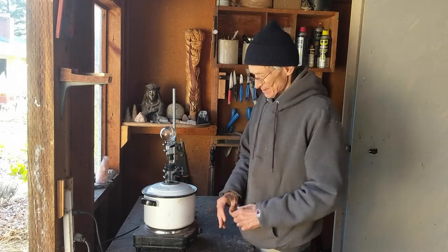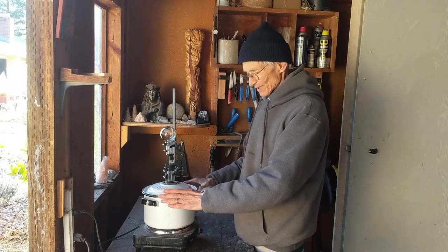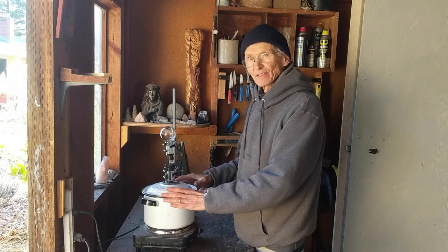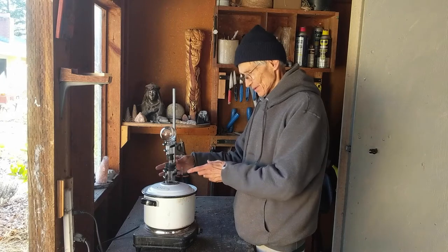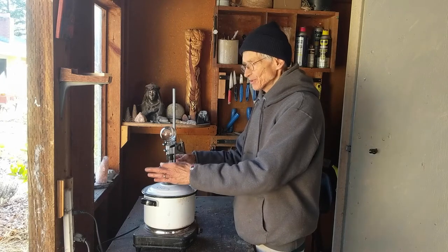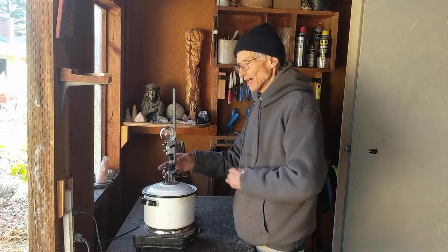Here you have a hot plate. Here you have a vessel with water in it that's very hot. Inside that you have a flask that's suspended on the stand. You have a double stopper and then this little guy at the top.